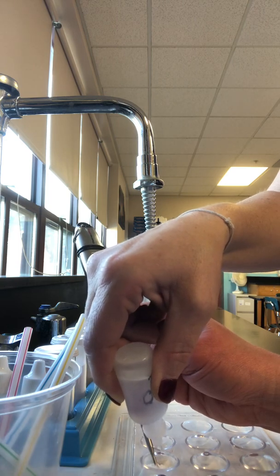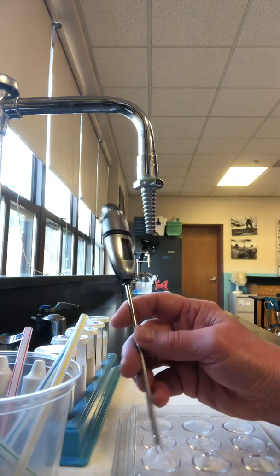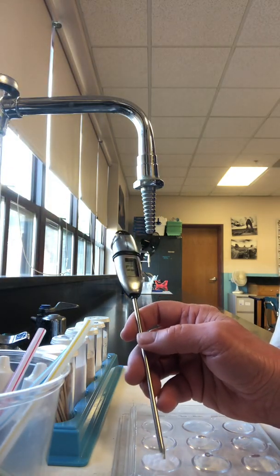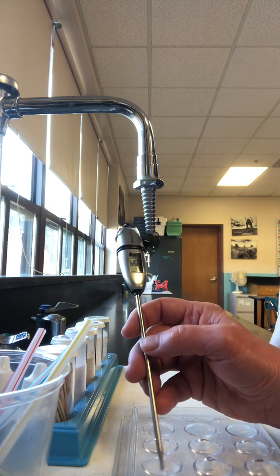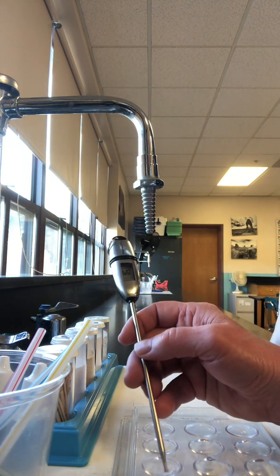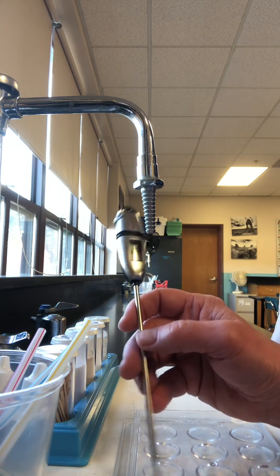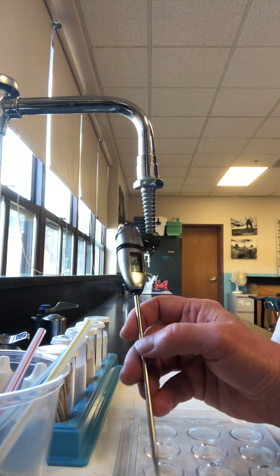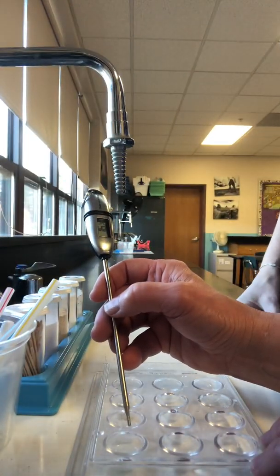Okay, go ahead. 1, 2, 3, 4, 5, 6, 7, 8, 9, 10. Let's do 21.9, and we're climbing down to 17. 17.1. 16.8. Looks like that might be it. 16.5. Noticing the big bubbles. Oh yeah, it's bubbling. Both of them have bubbles, but this one is much more bubbly. 16.2 looks like it for this one.